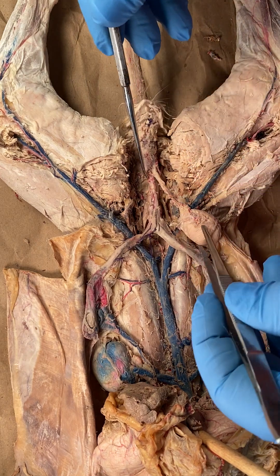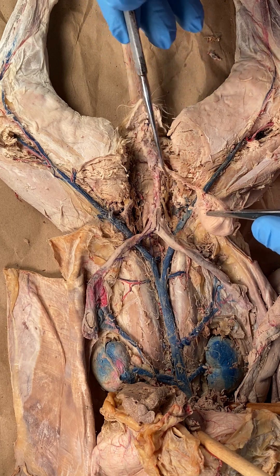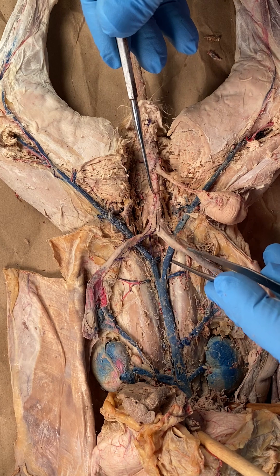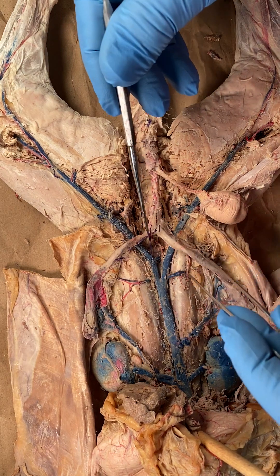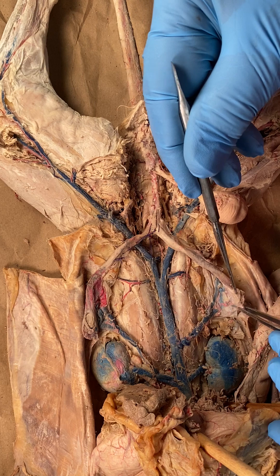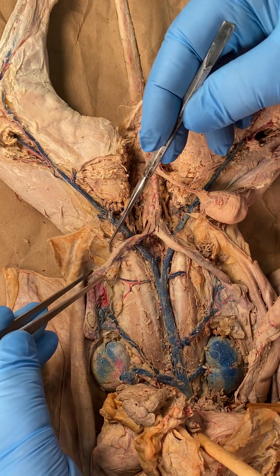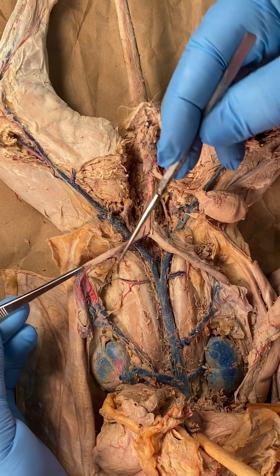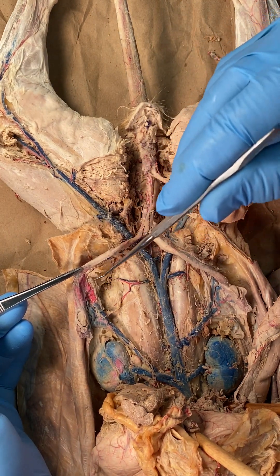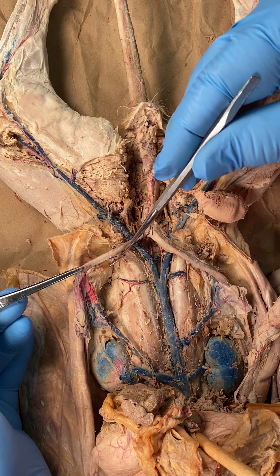Going backwards again: there's the vagina — it's after where the urethra joins. The little swollen area right there is the cervix, then the uterine body, right uterine horn, right ovary, left uterine horn, left ovary. Take note now that there is a huge broad ligament attached to the uterine horns and the uterine body.